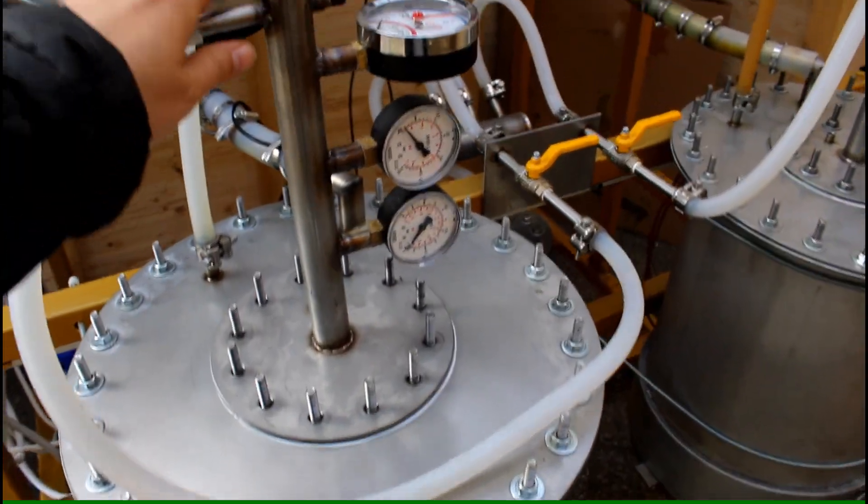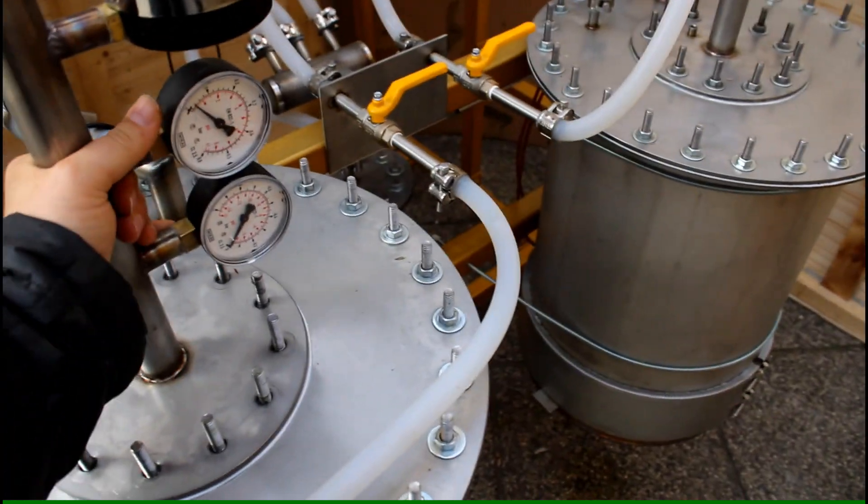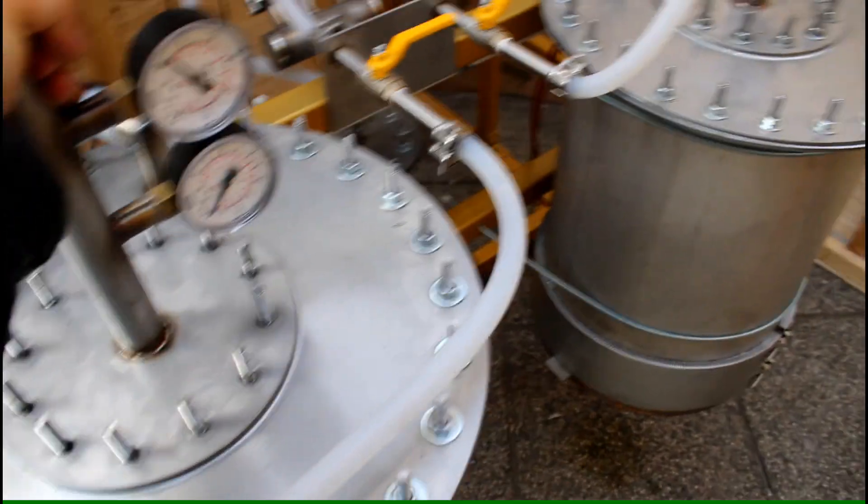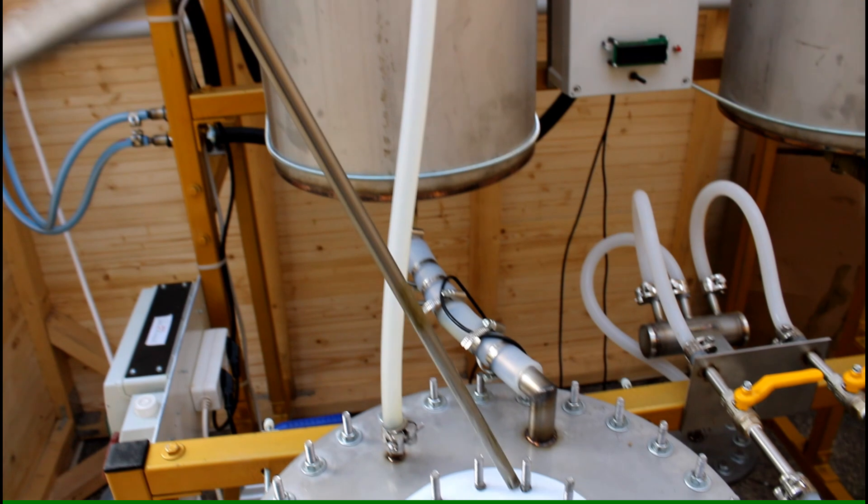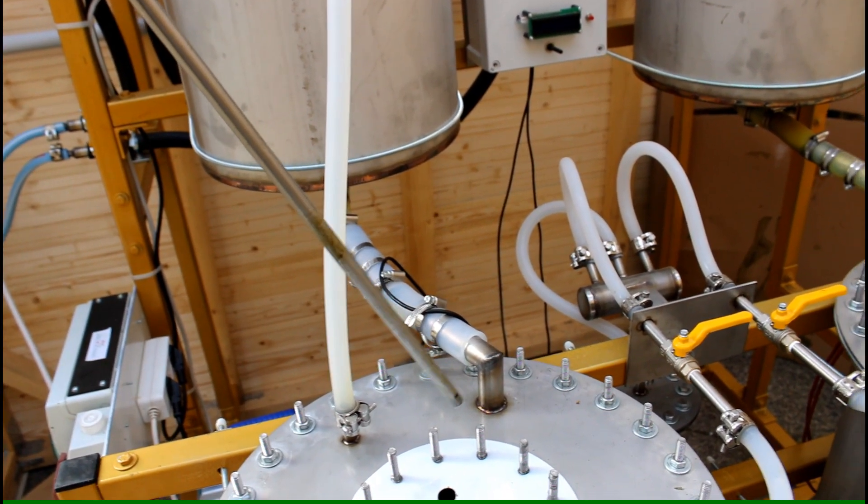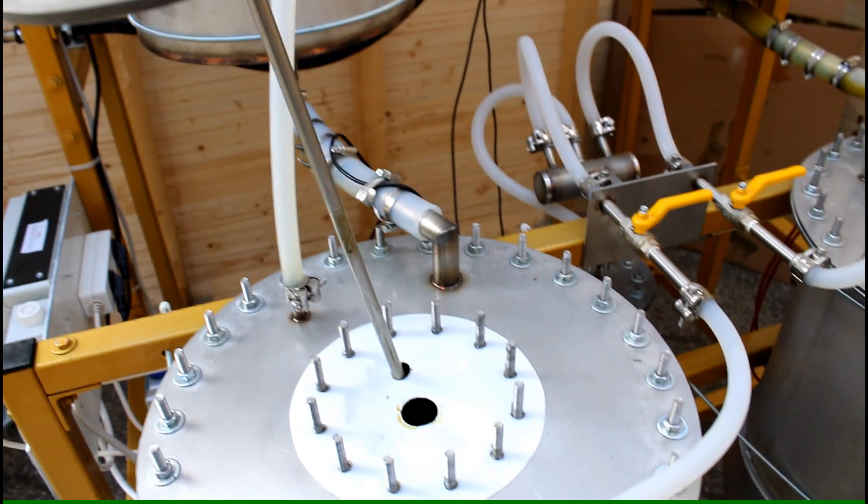Now we are going to have a closer look on these kind of things. So I'll take it out. The long tube that you can see here is basically for a temperature probe to measure the temperature of the solvent. This is also quite useful information.